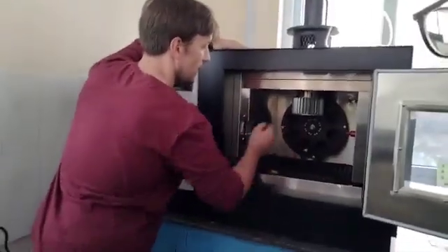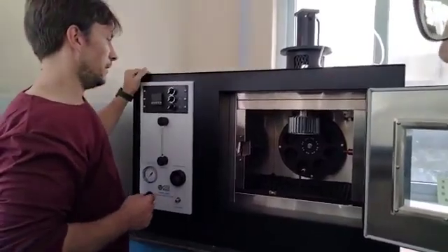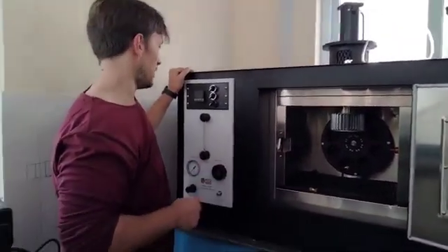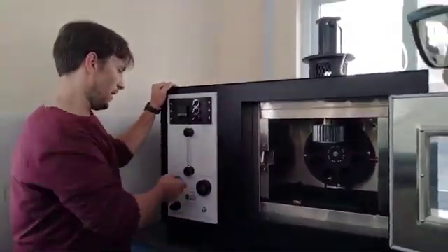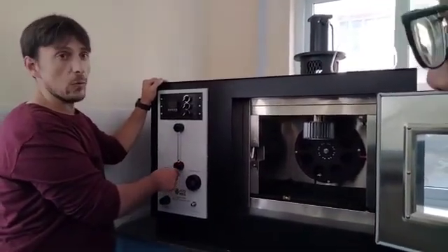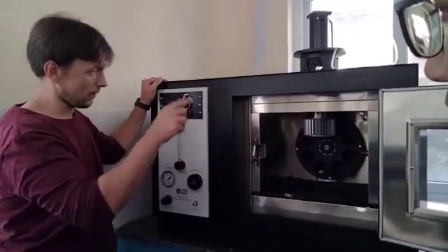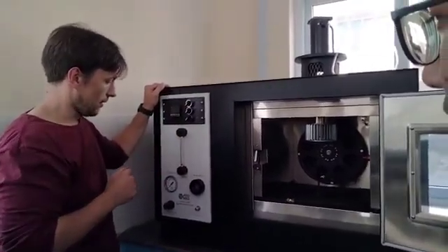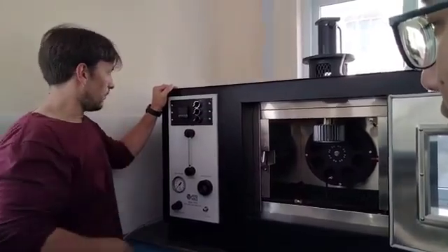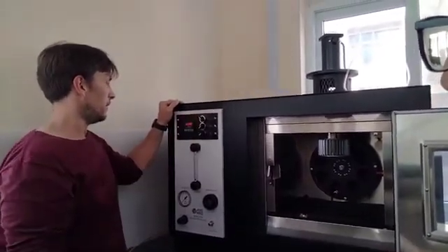So that's it for that part. This is a flow meter that we're going to use to regulate the quantity of air that is going to be introduced into each one of the glasses. So the first thing we need to do is to power on the equipment.